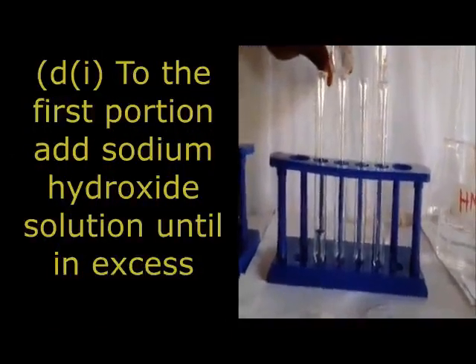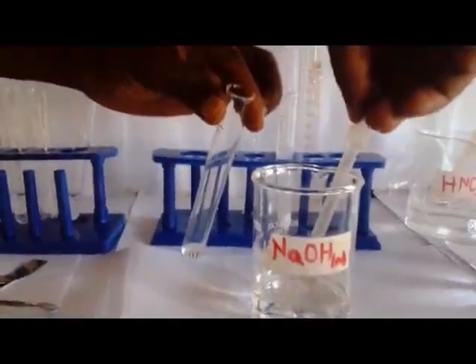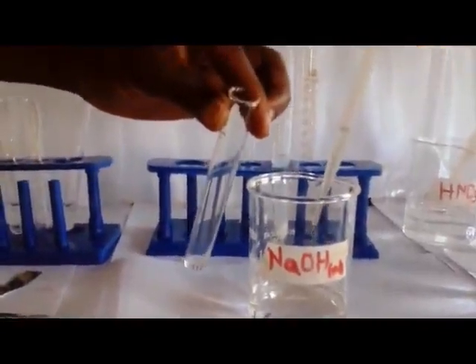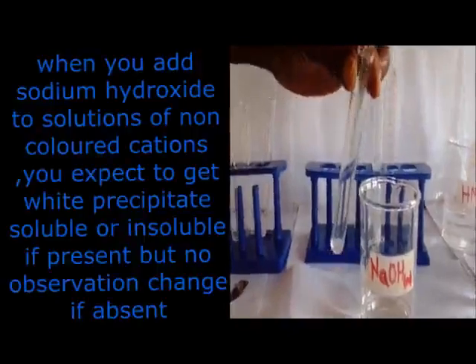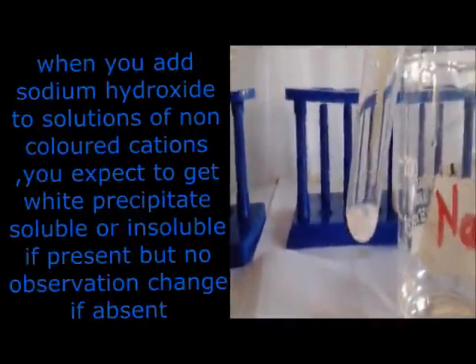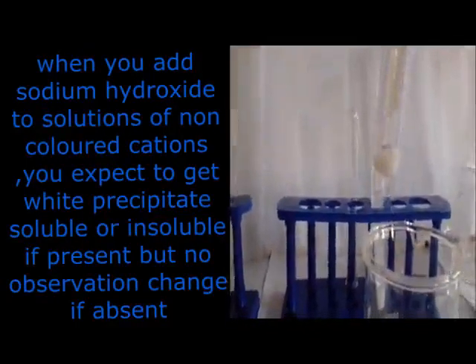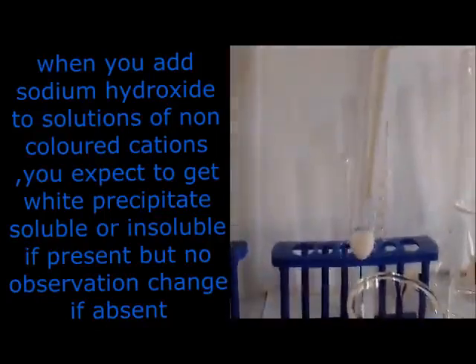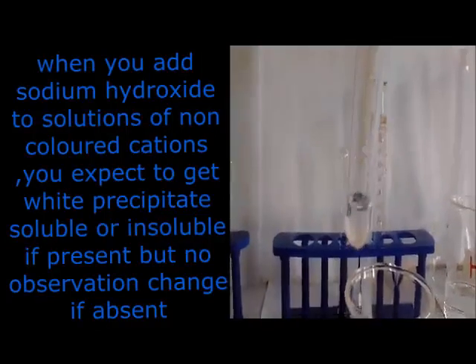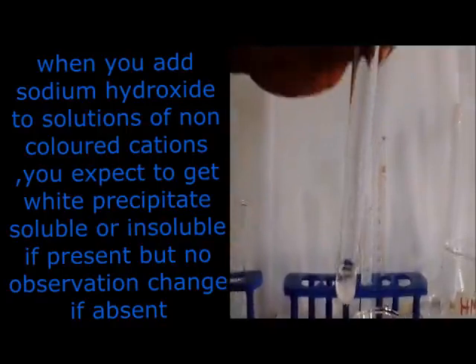Now for the first portion, the question is saying to add sodium hydroxide solution until in excess. That is our first portion. We are adding sodium hydroxide. Now when you are going to add your sodium hydroxide, make sure you use the dropper properly. You put the dropper in and press it so that it sucks. So now we are adding our sodium hydroxide.